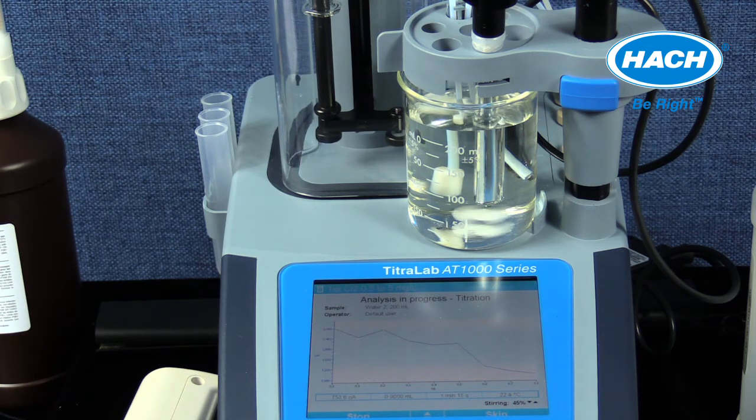As PAO is added to the sample, the free iodine is reduced to iodide at the cathode, and PAO is oxidized to a higher oxidation state and measured at the anode using an oxidation reduction potential, or ORP, electrode. When these two species are present at the two poles of the electrode, there is a current flow. As the free iodine concentration becomes less, the solution becomes less conductive, and the measured current drops. The endpoint is determined when there is no change in current, signaling that all the total chlorine has been reacted to oxidize the PAO. Eventually, you will see a flat line occur on the graph.